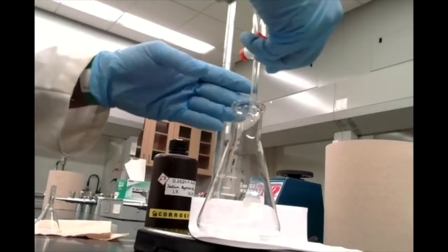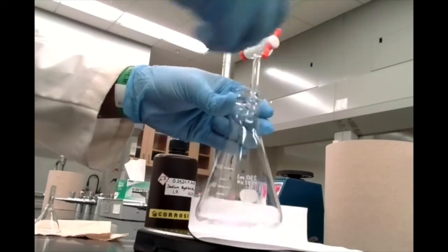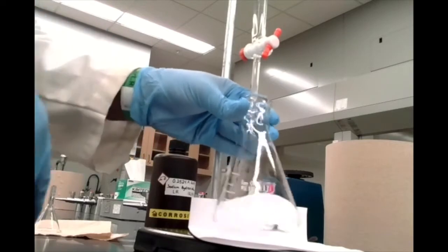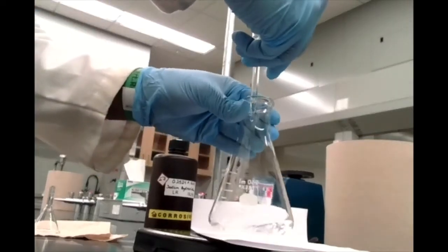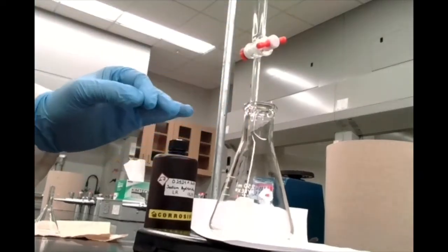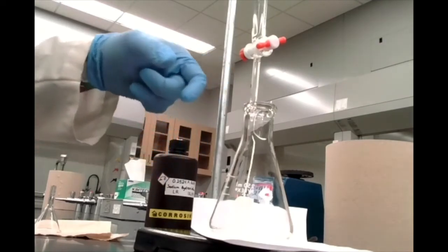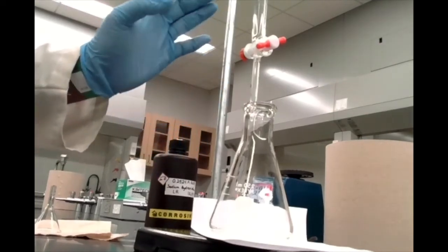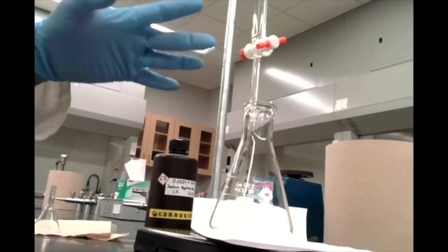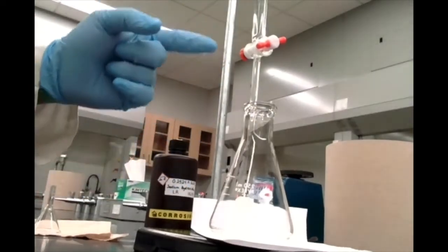As we add sodium hydroxide, I'm just going to keep on running this. You can see that as I continue to swirl, that pink color is disappearing relatively quickly. I don't know if you noticed that just now I stopped this just so that I have some time to react here. That pink color started staying a little bit longer no matter how much I was swirling it. That's telling me that I'm getting closer to the end point, so I probably want to be a little careful here. I was adding a whole bunch of sodium hydroxide at once.